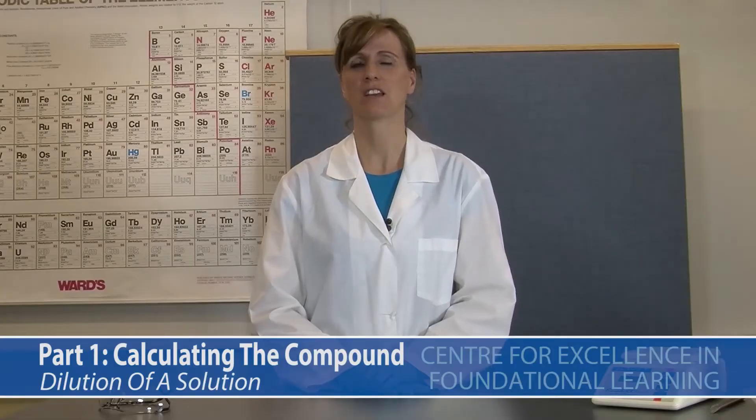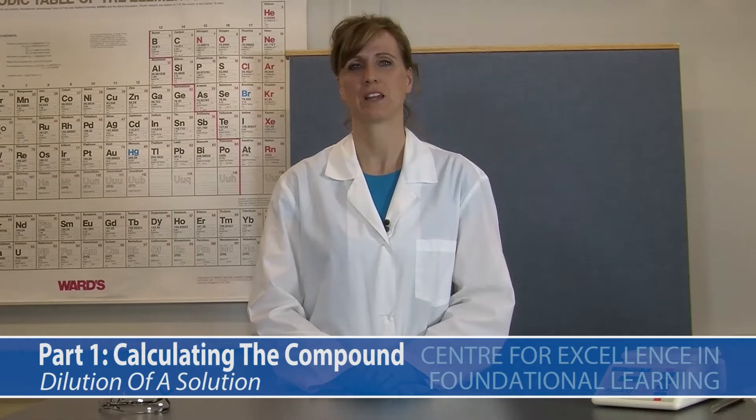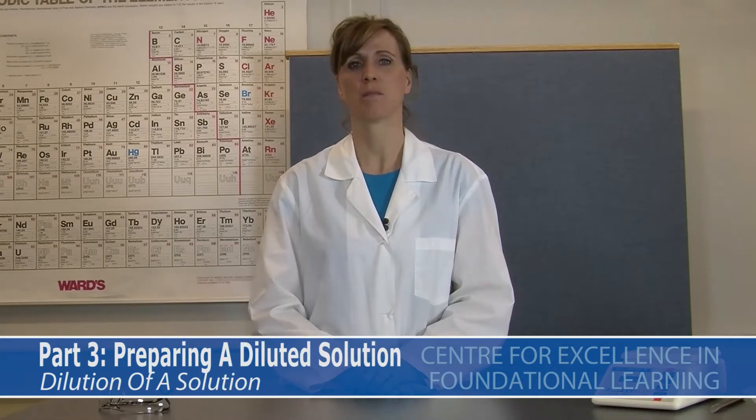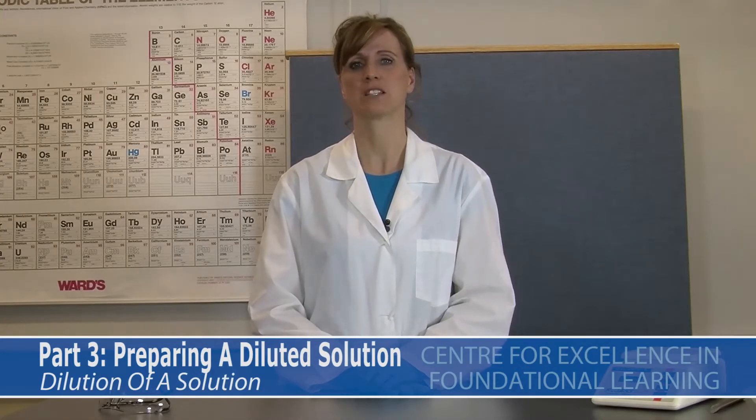Hi, I'm Patti. Today we're going to review the common procedure and technique for preparing a concentrated stock solution. Then we're going to dilute that stock solution to a known concentration. This is a three-part procedure. Part 1 is calculating the amount of compound needed. Part 2 is preparing the concentrated stock solution. Part 3 is preparing a diluted solution.